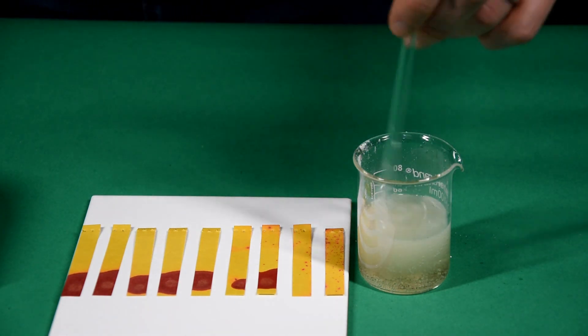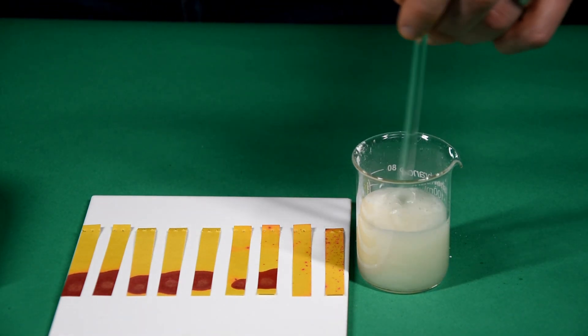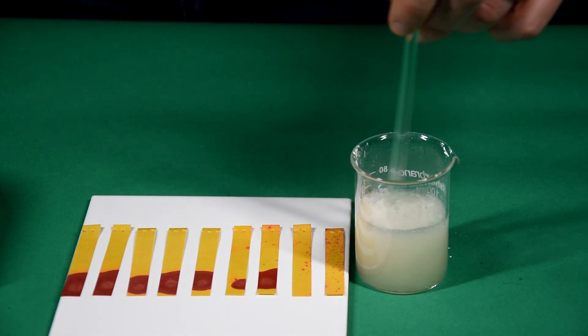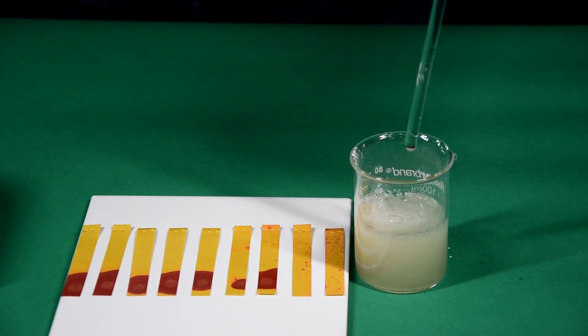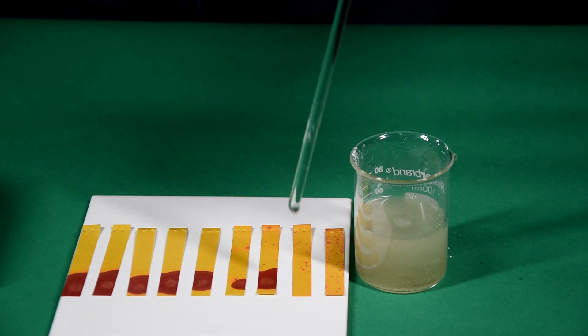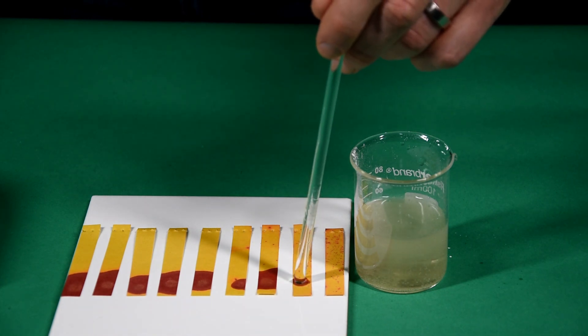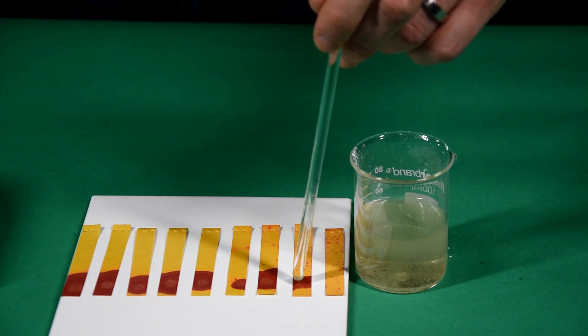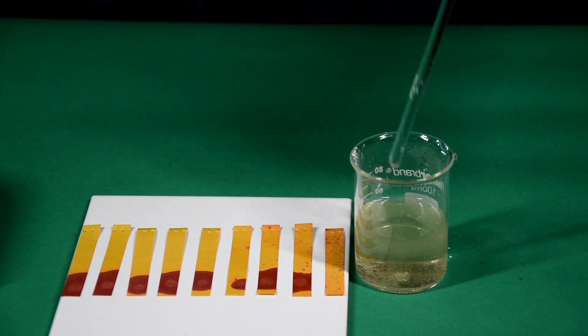Still signs of the acid reacting with the alkali, indicating excess acid. And the universal indicator paper is showing exactly the same thing.